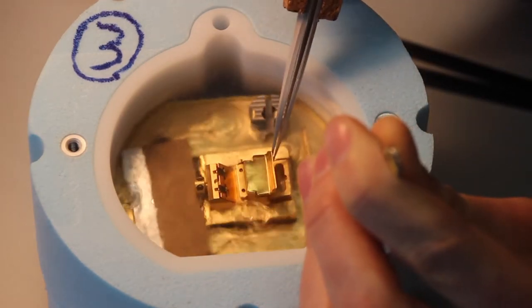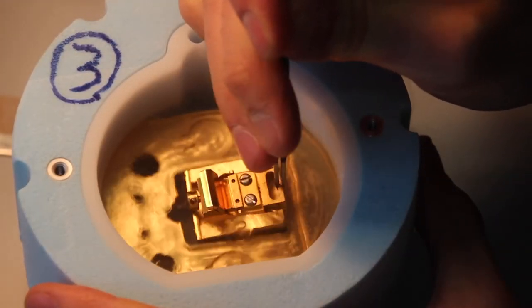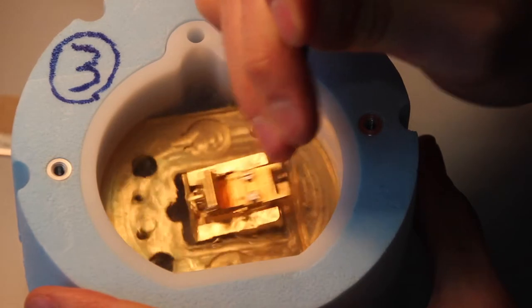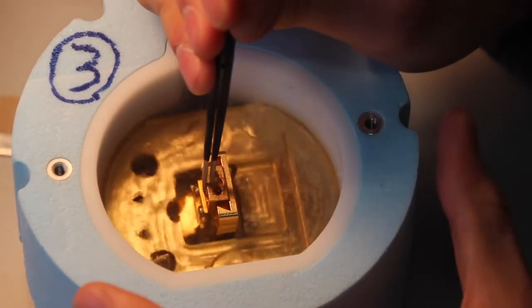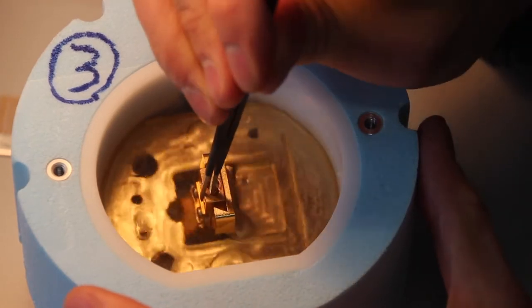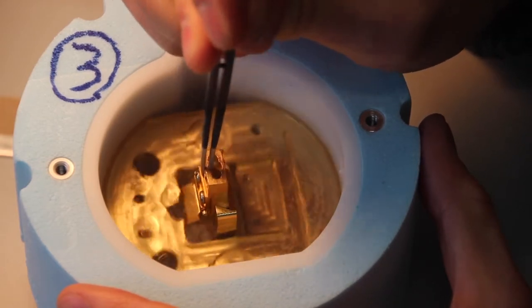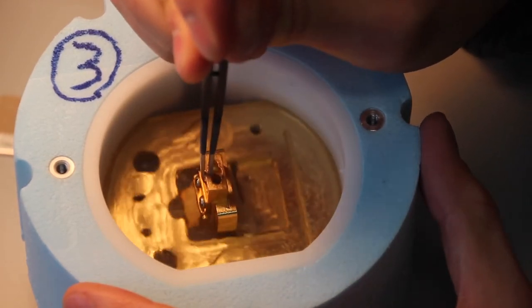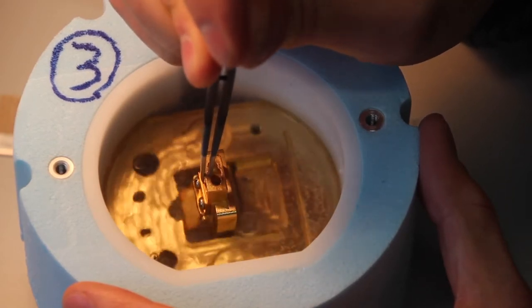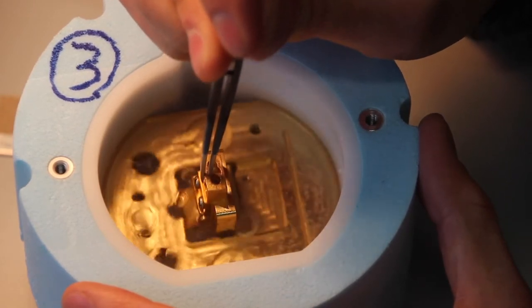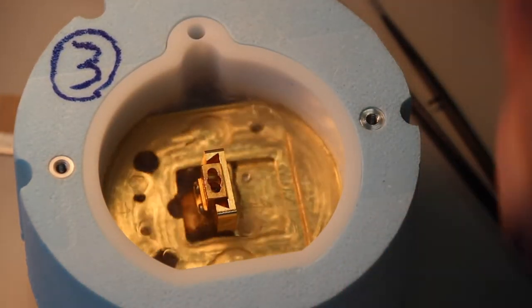Now we will close the shield. Now our shuttle is free, and we're going to rotate it like this. Now this is important here: you want to make sure that the shuttle is able to slide up and down, because when we grab it at the station we won't have the opportunity to fix this. So make sure that the shuttle is able to just slide up and down with your tweezers here. And top off with liquid nitrogen.